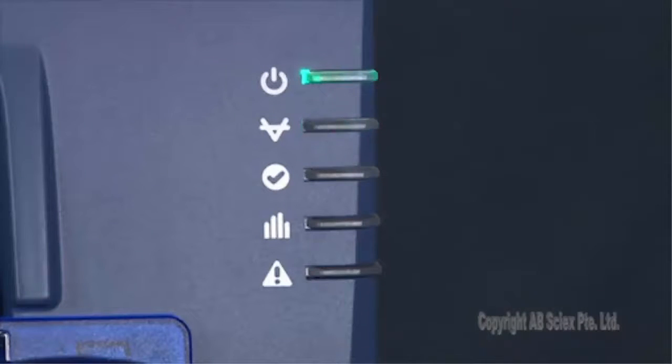After 15 minutes, the power LED will be steady on, the vacuum LED will be off, and the ready LED will be flashing.